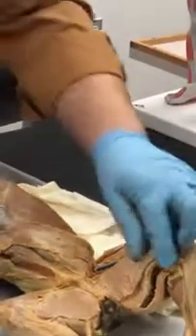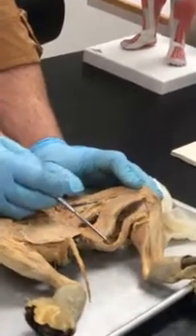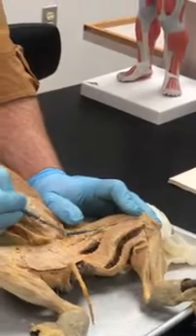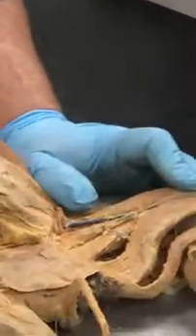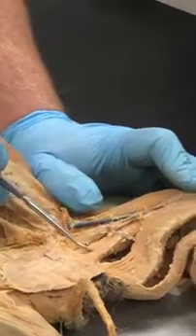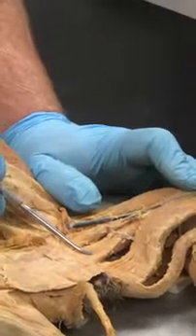All right. So that's the gracilis over here. Now, again, here's a semitendinosus. Here's a semimembranosus. And then you've got two adductors. There's one here and there's one here. I'll show you a little mnemonic to help you memorize this. I just came up with it the other class. This is the adductor magnus, also referred to as the adductor femoris.